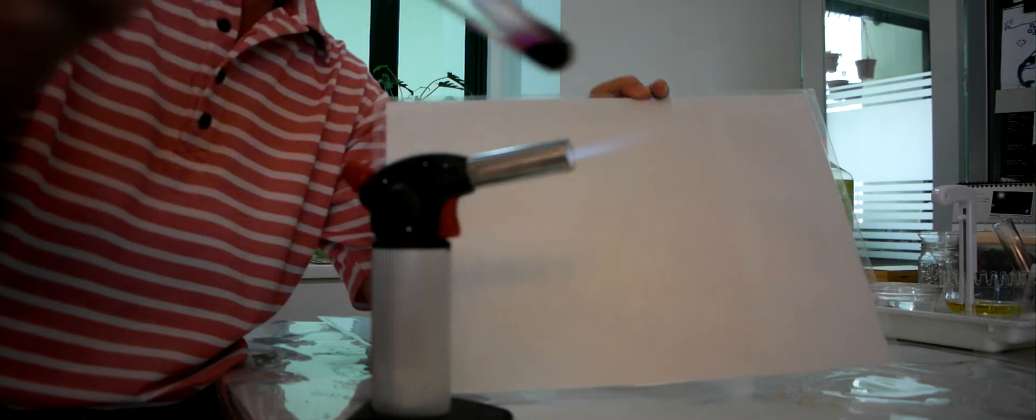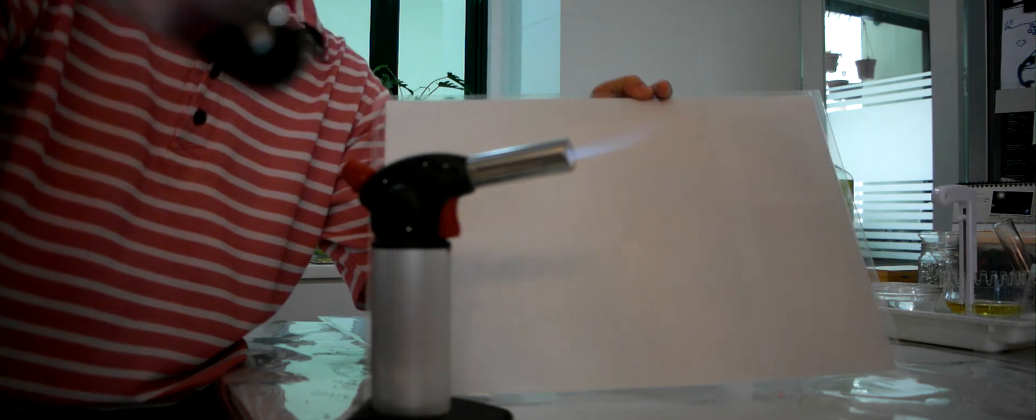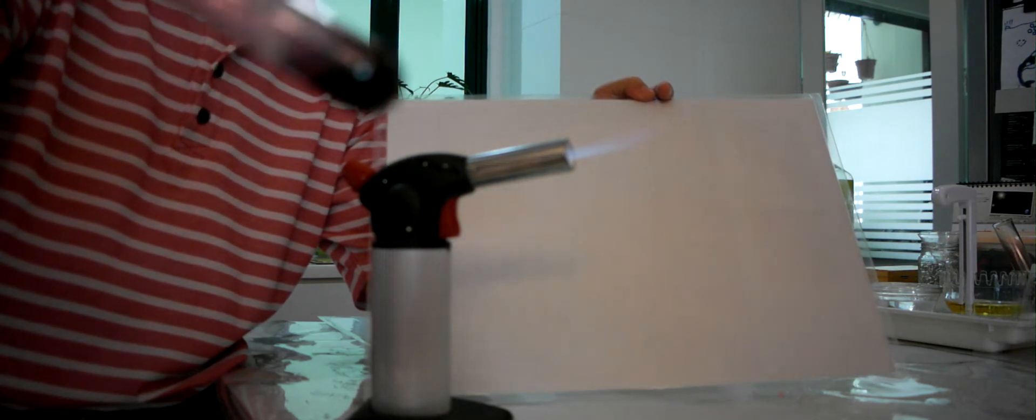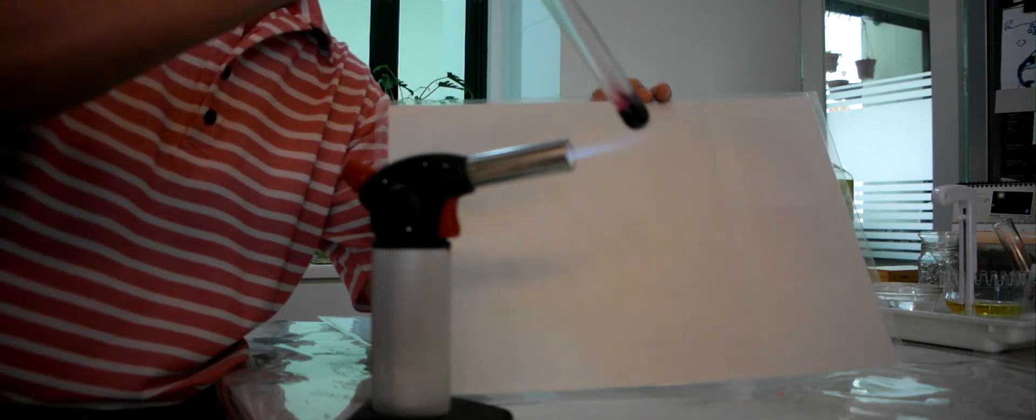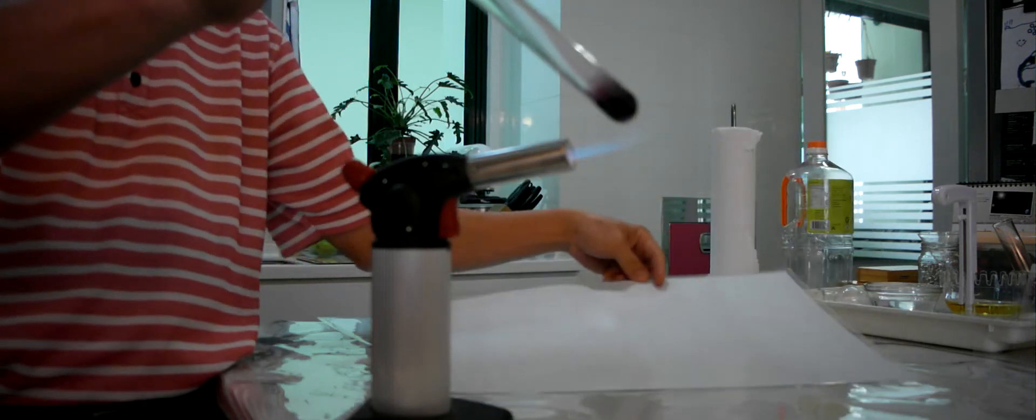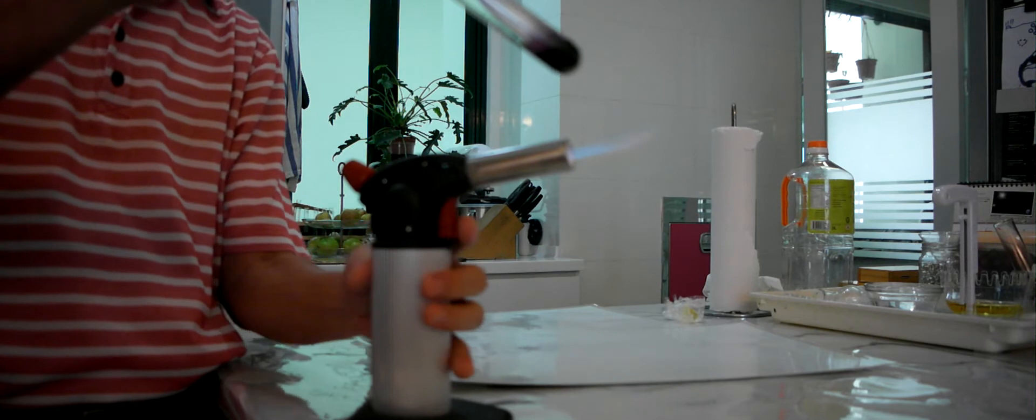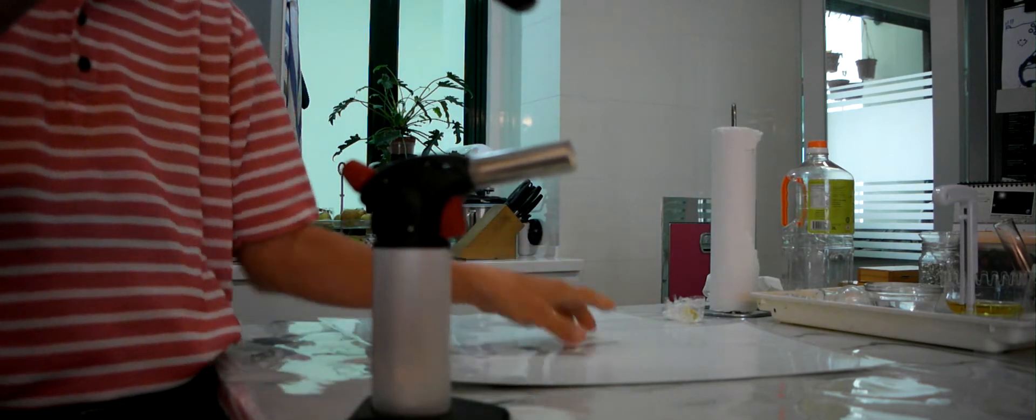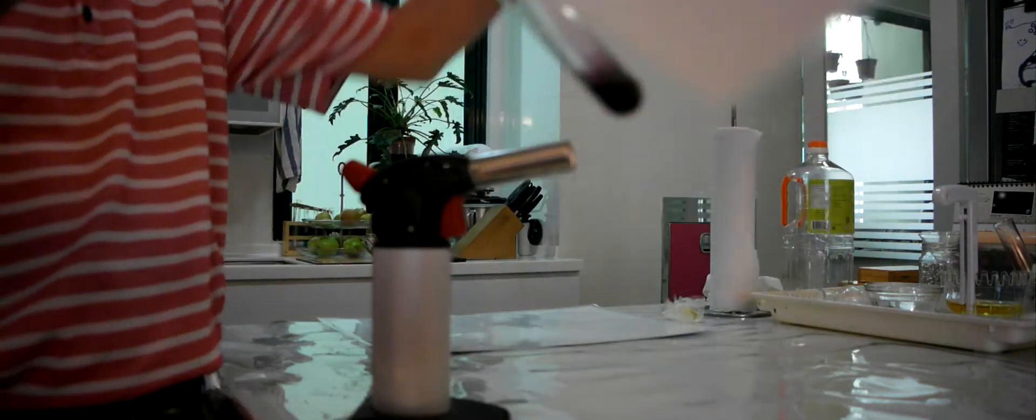Can you see the liquid inside? So what we are going to do now is we are going to pour out the liquid iodine. Let's see. We pour out the liquid iodine and let it flow.